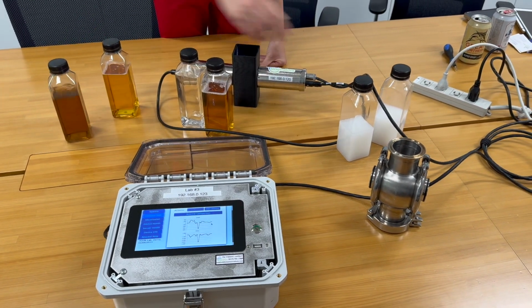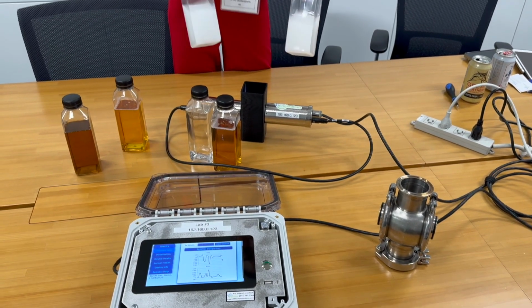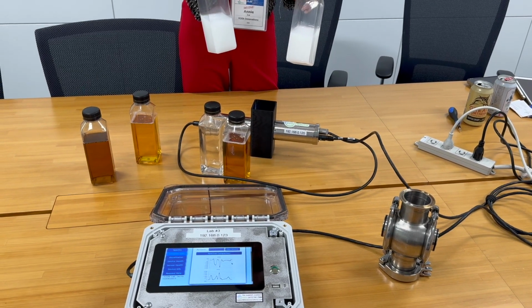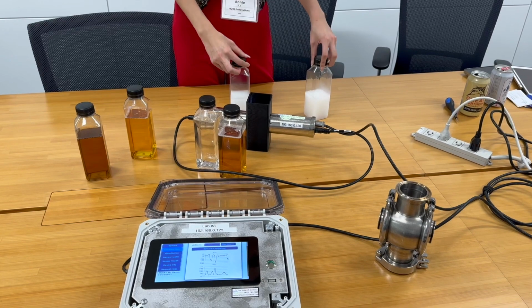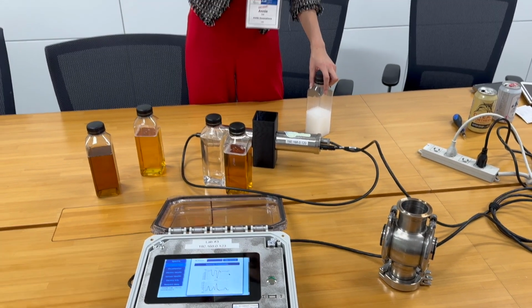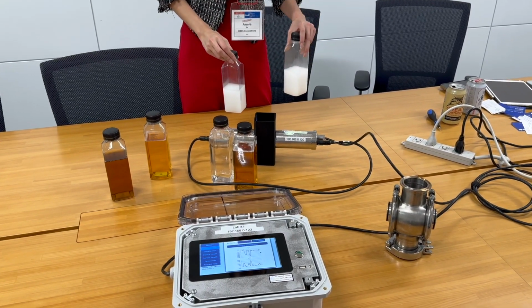Now what's really interesting is, you can put this to the test even further. These are two of the same body wash from an FMCG, personal care company, two different fragrances. When we're doing a changeover, for example, we stop making this first fragrance body wash. It's made from the same common base material.